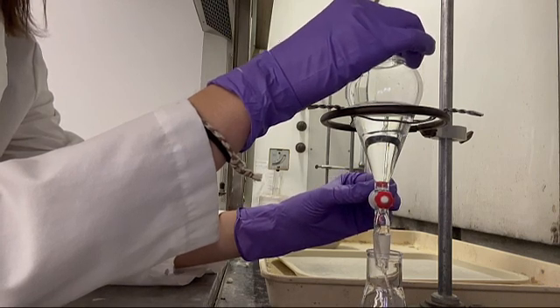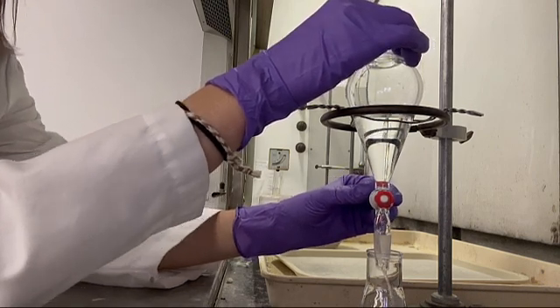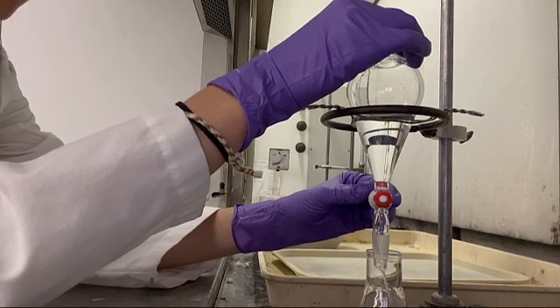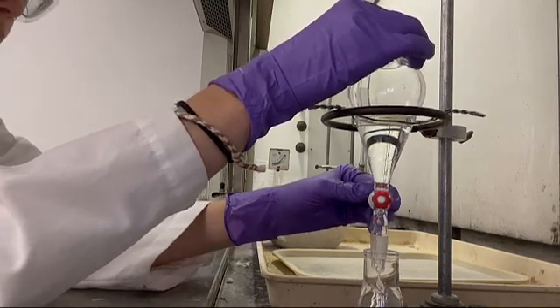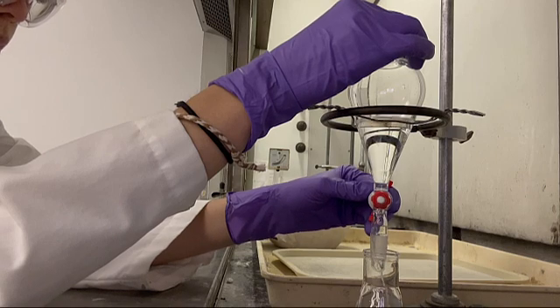Be aware of common mistakes that can occur during this process which include over-shaking the funnel, forgetting to vent the funnel, and improperly draining the layers.